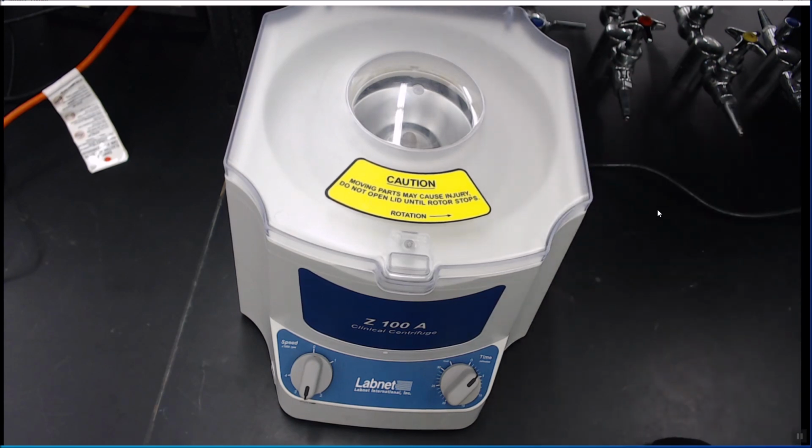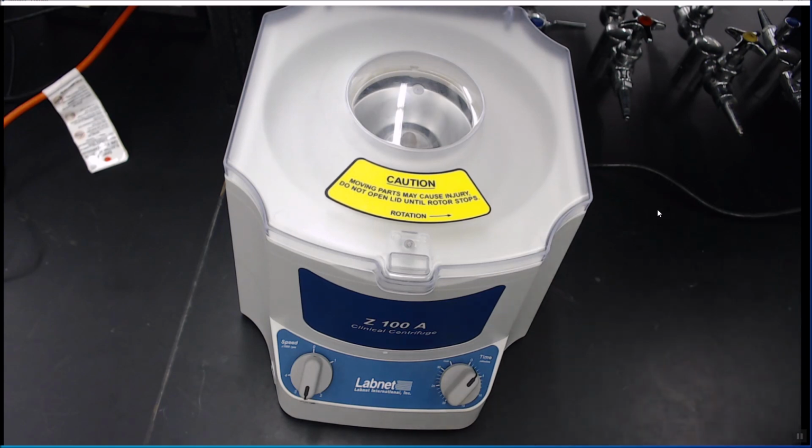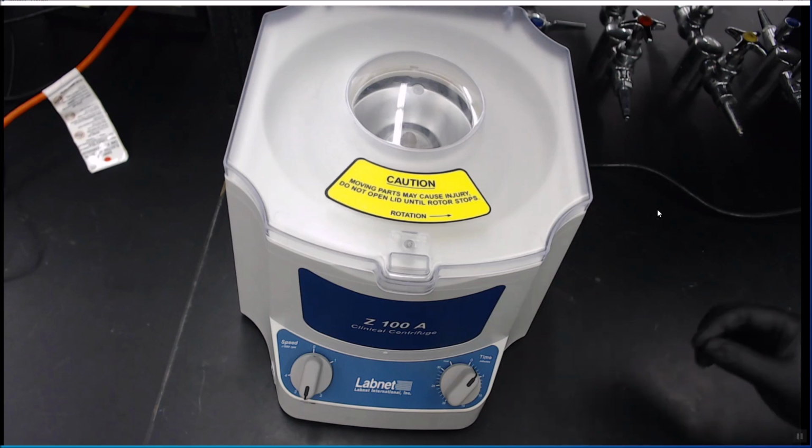The way you will do this, once this is done, is you will very carefully pour off the liquid on top into a beaker. Please take great care not to pour out your copper. If you do that, you have just lost that whole trial. You can't put it back. So you want to pour very slowly. We'll demonstrate that when this is done.